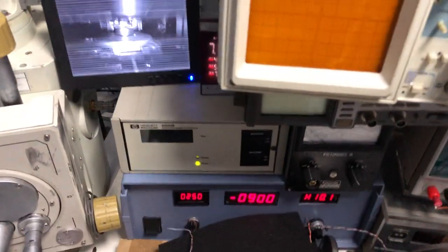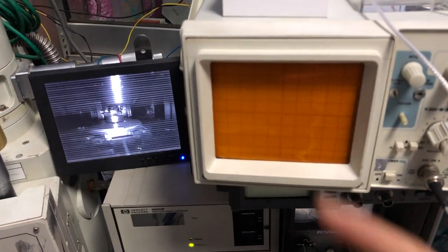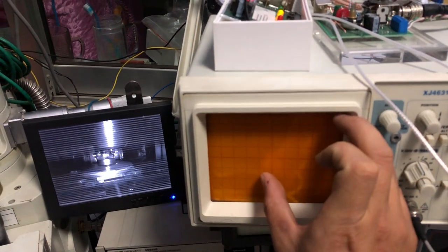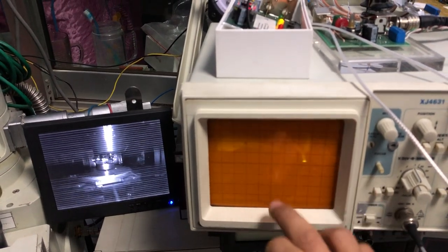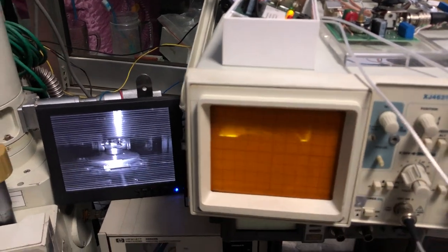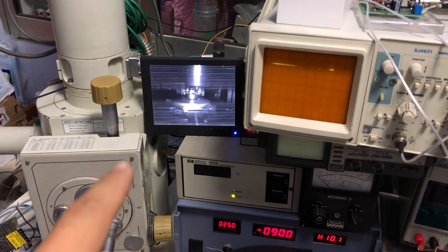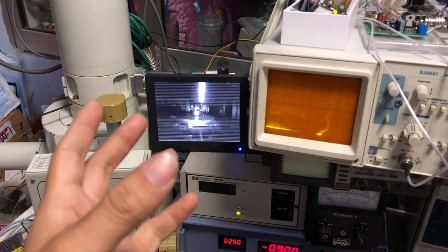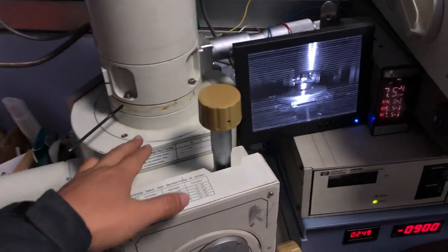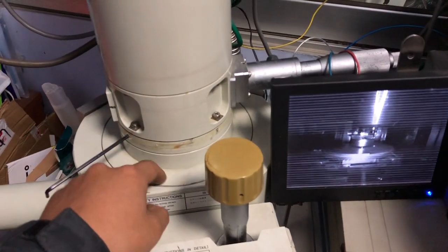So when I see the picture and adjust the focus, the image is moving back and forth, back and forth in this direction, this direction. So I think maybe I got the column not aligned with this structure inside the sample chamber.